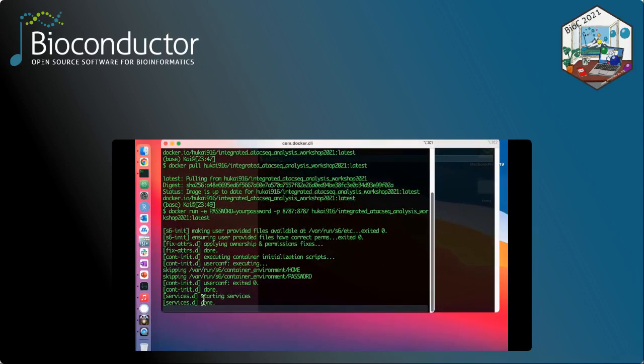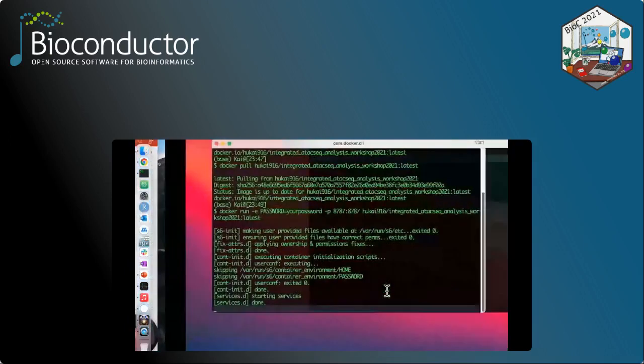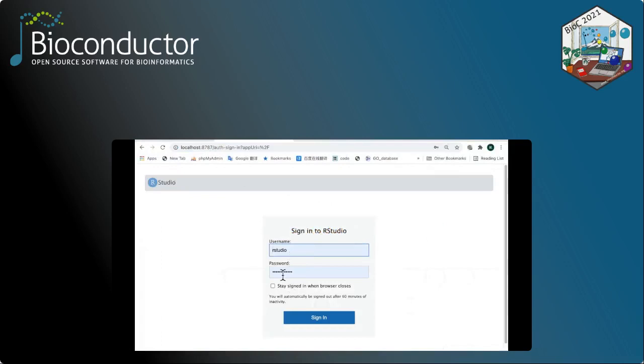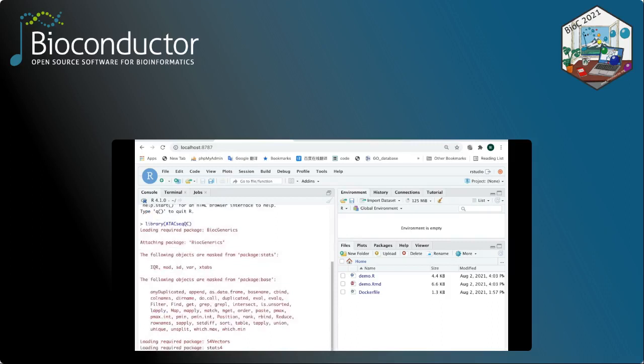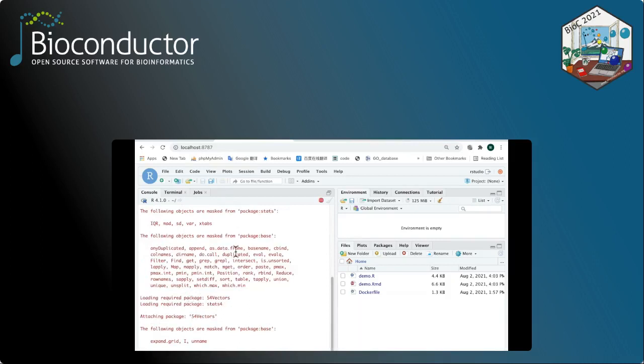Now you can see that the container is already started. After you see this, you can go to the browser and type in the localhost address like this. Log in with rstudio and the password. After you sign in, you can see this RStudio interface. Now, in order to see whether this container is working properly, you can try to load some of the libraries. For example, ATACseqQC. Now you can see that this package can be successfully loaded into the environment, meaning that the environment is working properly.